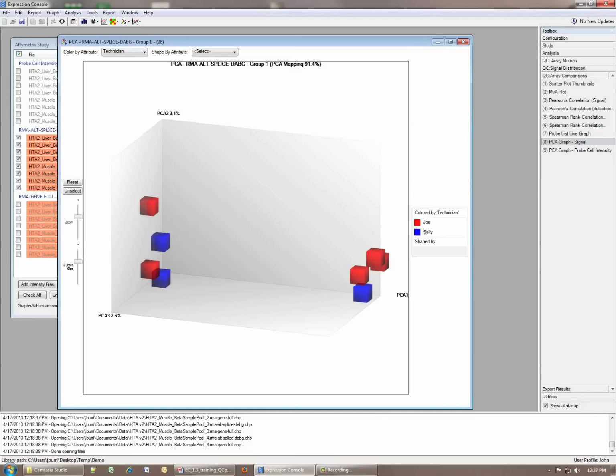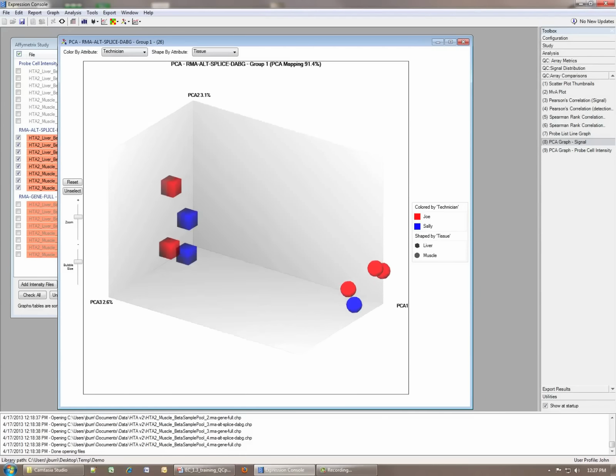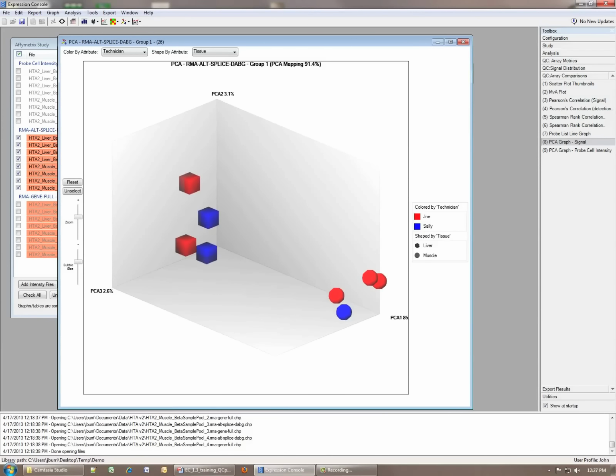So we can color by one attribute and we can shape by another attribute. In this case, let's try and shape by the attribute we care about, which is actually the tissue. So if we look at this, we can see now that the liver is displayed by squares and that the muscle is displayed by circles. So in this case, when you rotate these around, you can see that the liver samples and the muscle samples are separate, and that the 2 clouds that are formed are basically dependent on the sample type, which is what is of interest to us.